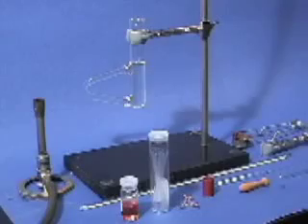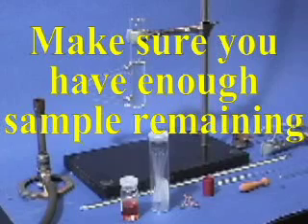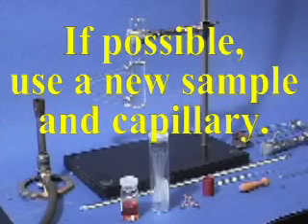To repeat a measurement, one should wait for the temperature to drop by at least 20 degrees Celsius and make sure there is enough sample remaining in the test tube. Ideally, one should use a new sample and also replace the capillary tube.